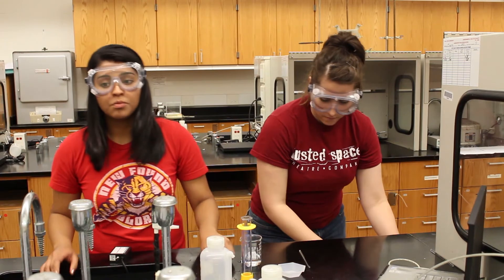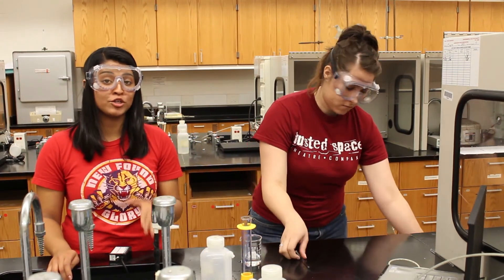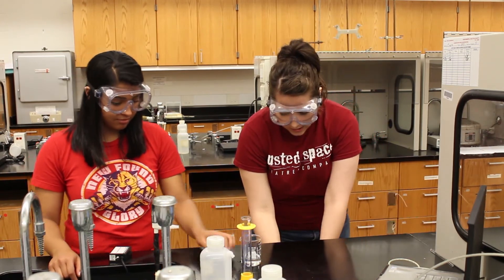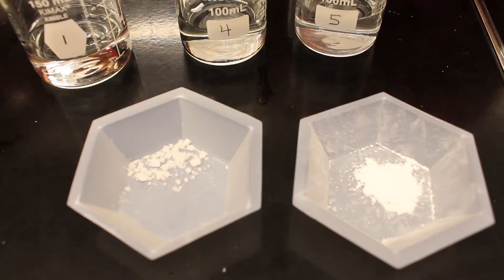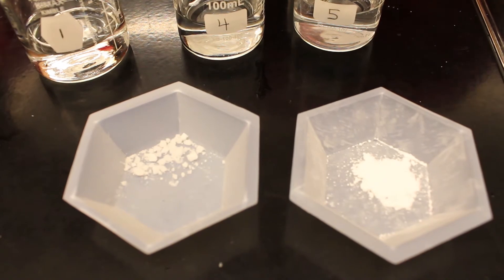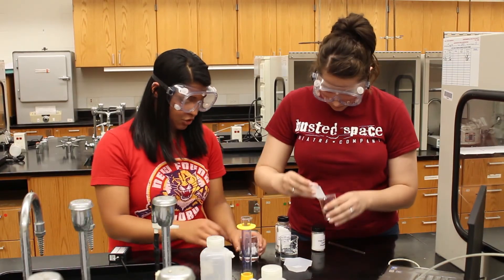When finished with this step, make sure you dispose of the contents in beakers 2 and 3. In this next part of the lab, we'll see how the solubility of a solution affects its conductivity. Once you have your samples measured out, make sure you add each of the samples into the proper beaker, and stir for one minute each.